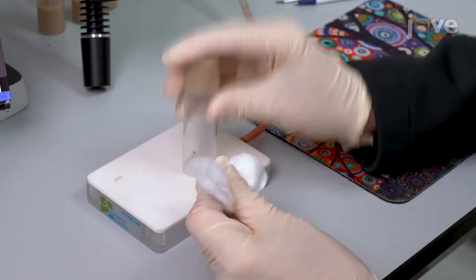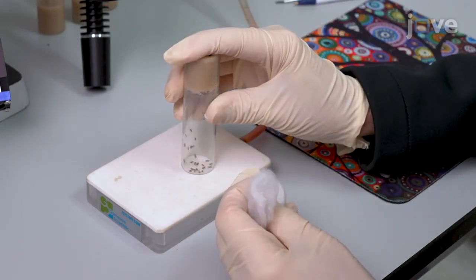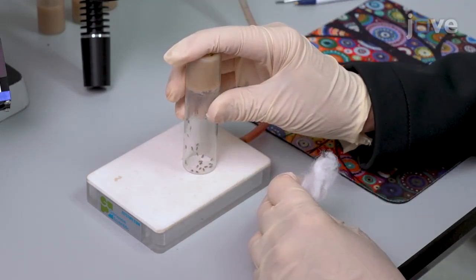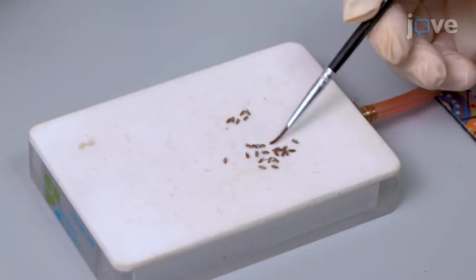Once the tools are clean and dry, transfer 40 or fewer assorted F1 males onto the clean pad and separate them into two groups.